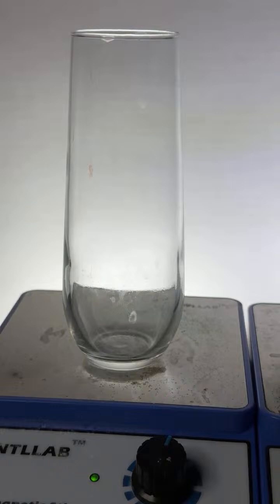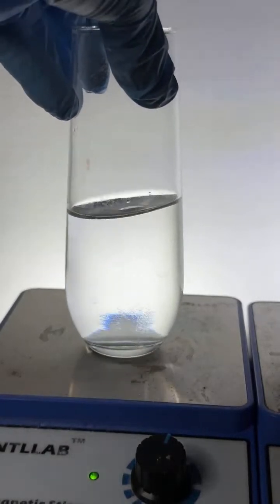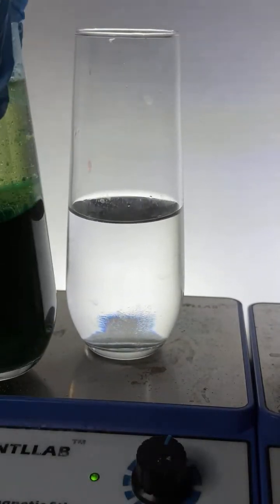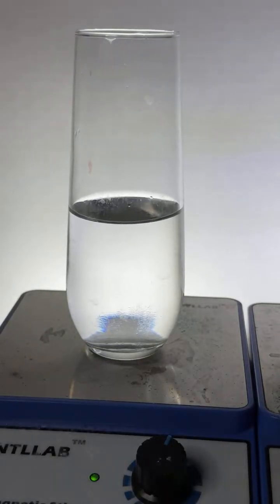What if I put a whirlpool in it? We'll try that next, okay? Let's just let it ride slow here for a bit. Okay, there's our water. Is that how much I did last time? No, I did a little more. Okay, so there's my water. All right, now let's add some. This isn't the water I drank.